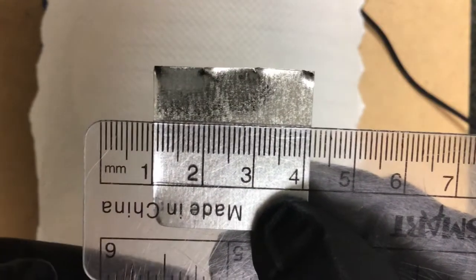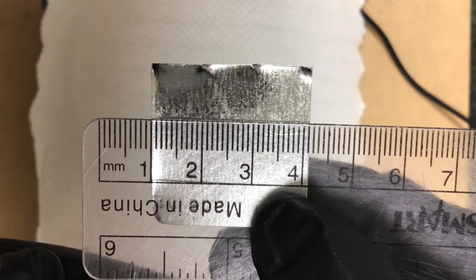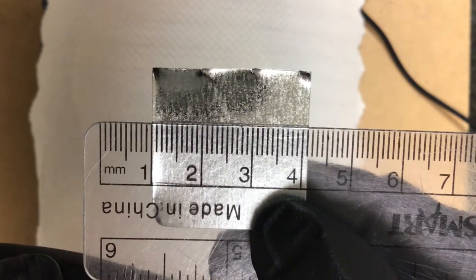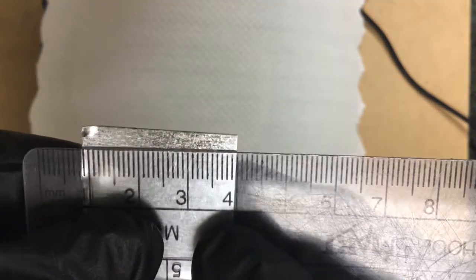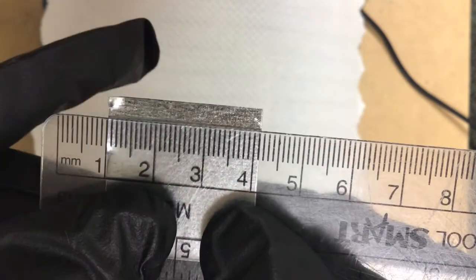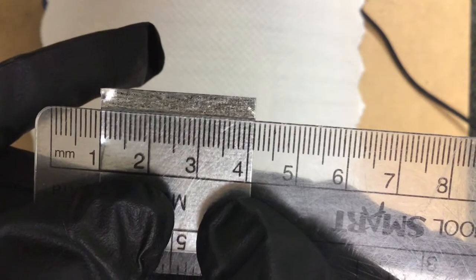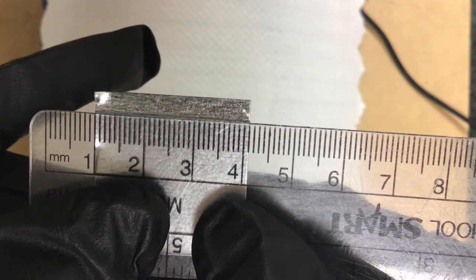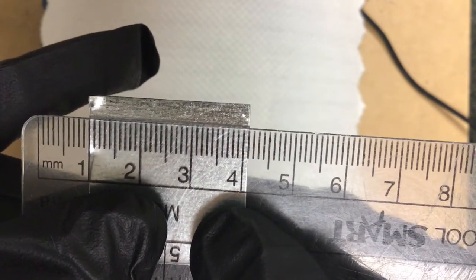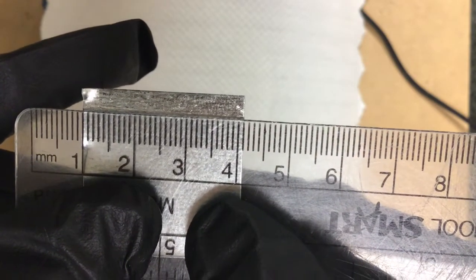All right, this is going to be the length for our trial 1 piece of galvanized iron. And then we'll get a width on that. Again, I'm starting at the 1 and going from there. Hold on right there, that's what we want. Again, you're just trying to get accuracy to the 10th place. Now, normally we would estimate to the 100th place, but in the lab directions, that difference isn't going to matter.